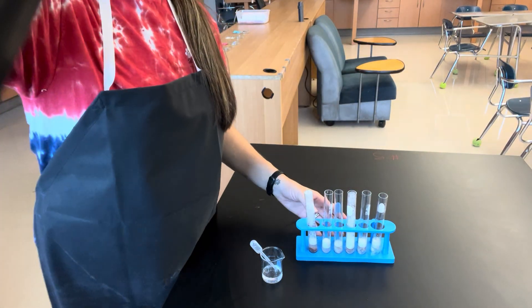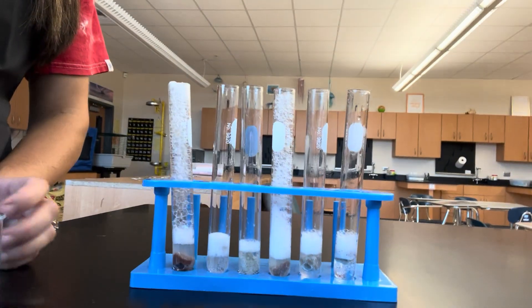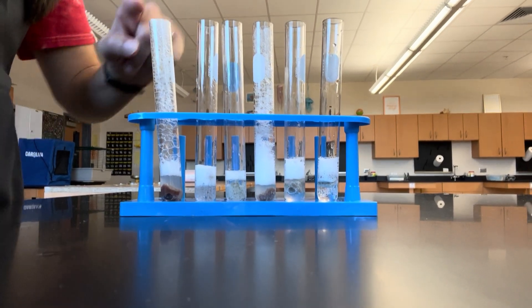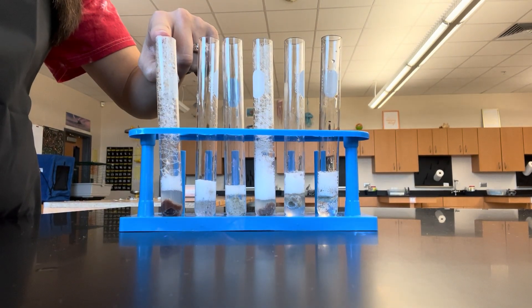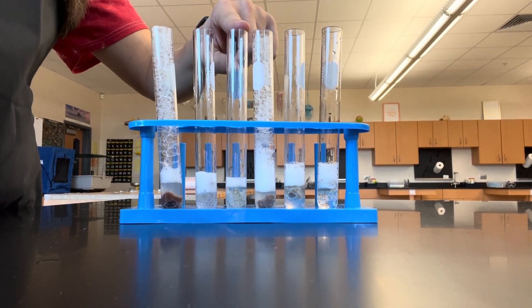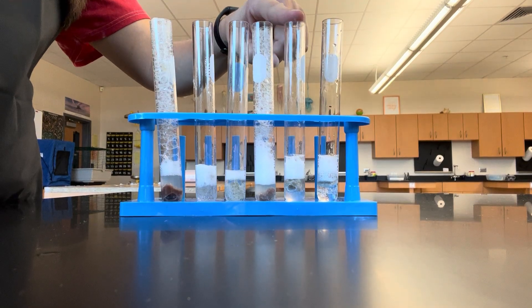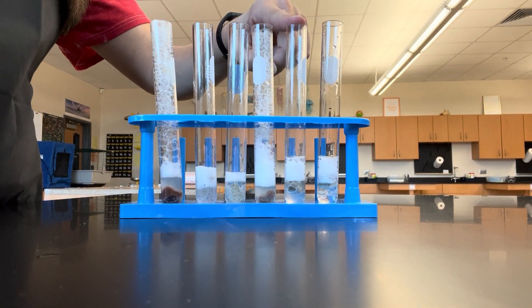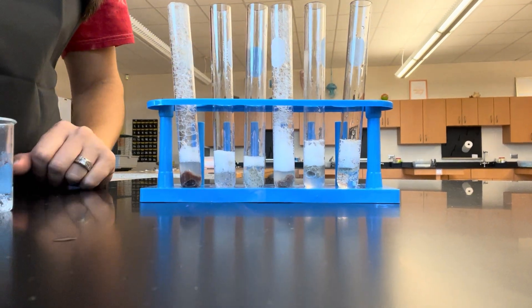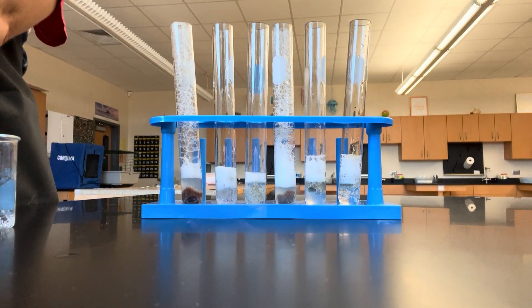To give you a closer view, here are the different enzyme reactions. This one is our raw, this is our potato, this is our cooked, this is our frozen, this is our low pH or acid, and this is our high pH or base.